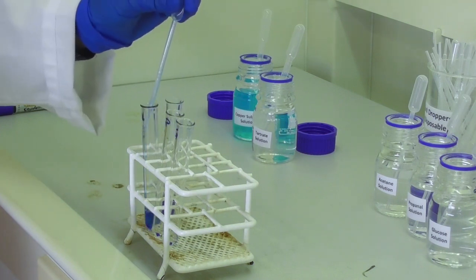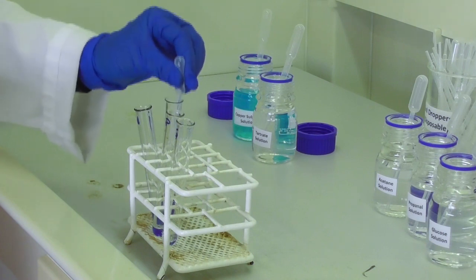We then add Fehling solution to each of the three test tubes.